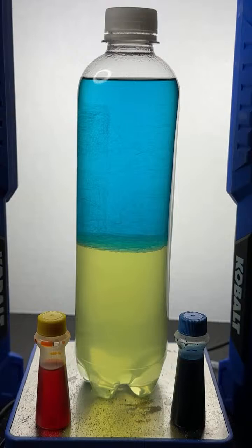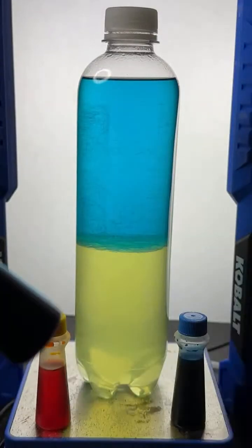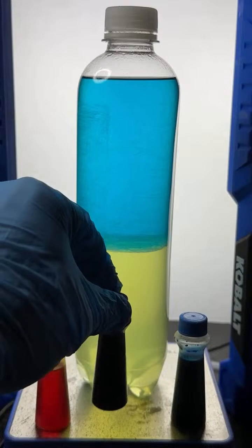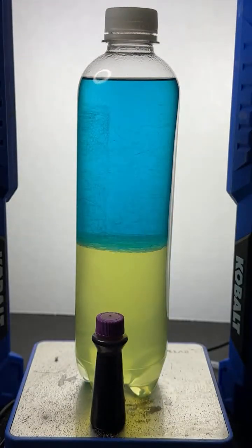Well, folks, this is all I got. I don't have any real interesting colors. I got some neon colors we can try. It looks like I got neon pink. Let's try neon purple. I think this one works pretty well. We're going to try this one, okay? I think this does something interesting. If not, I'll just add a second color and we'll goof around with it, okay? So let's repeat this experiment.